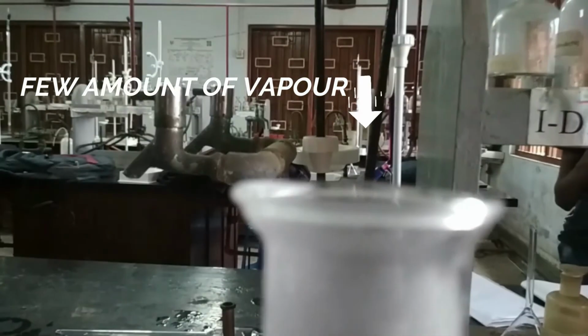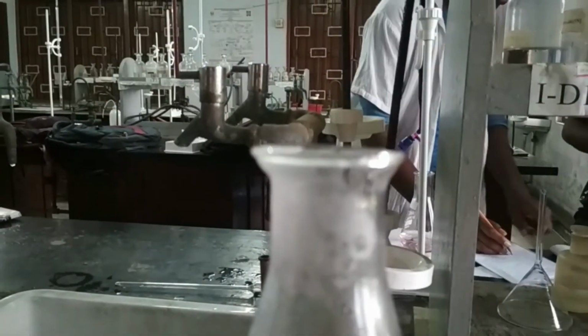During heating, when this water vapor layer outside the conical flask wall gets vaporized again and becomes dry, and a small amount of vapor is released from inside the conical flask, then the solution temperature has just crossed 70 degrees centigrade.